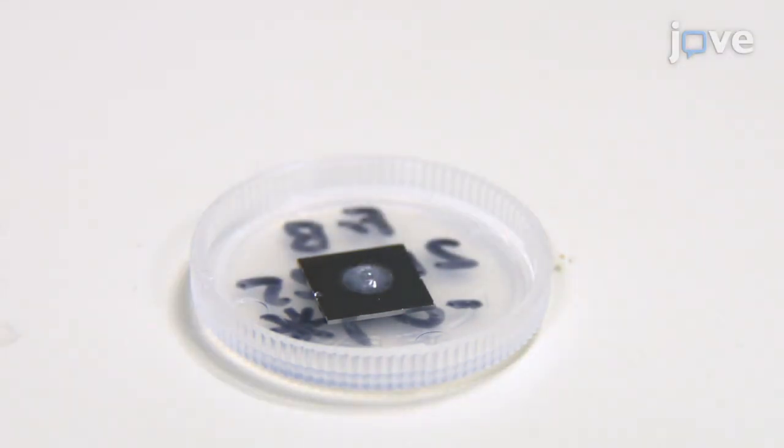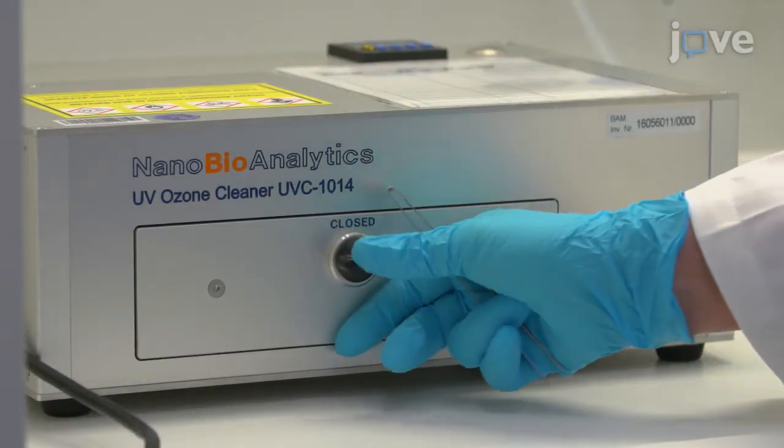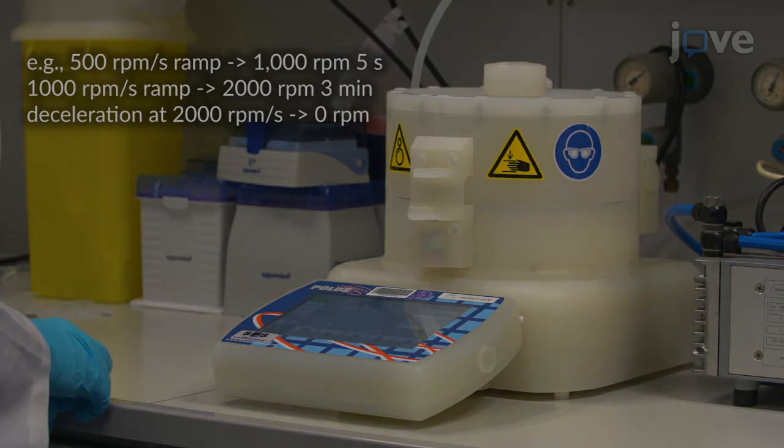To prepare nanoparticle suspensions by spin coating, place a prepared wafer into the UV ozone cleaner for 30 minutes and program the spin coater as indicated.